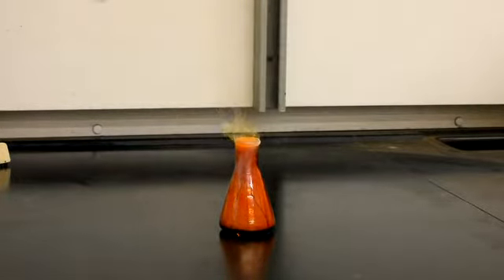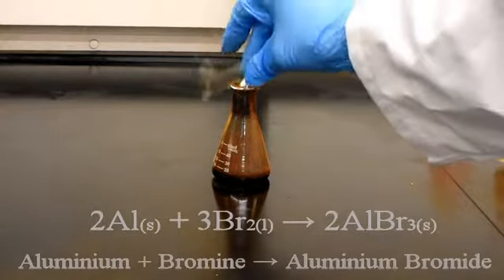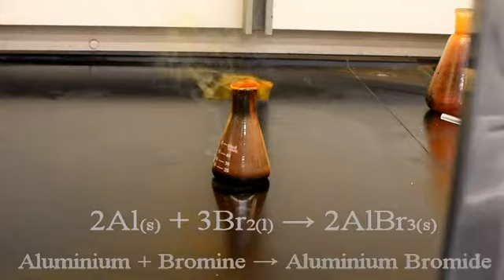So let's see the same reaction again, aluminium and bromine, but this time with a slightly larger piece of aluminium.